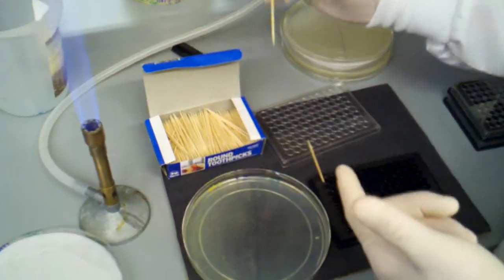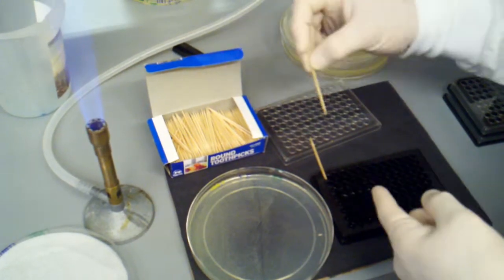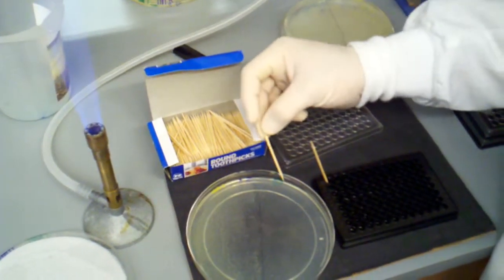Whereas if I was to take it out, then I might get confused, lose my numbering, and then go back into that one. So we'll just do a few more.